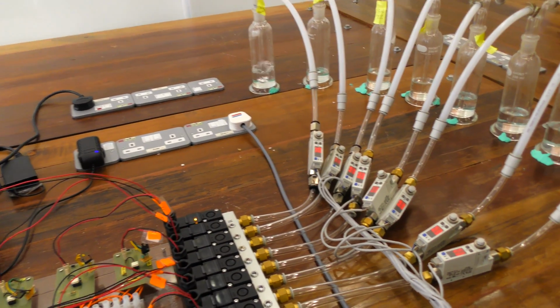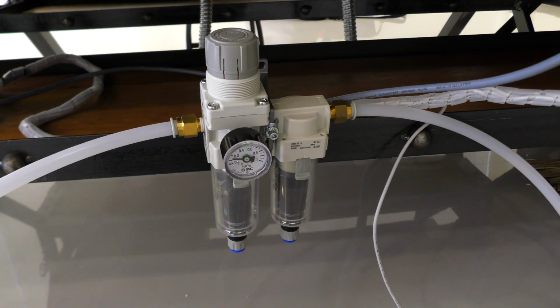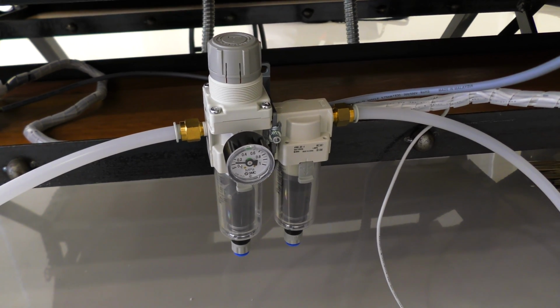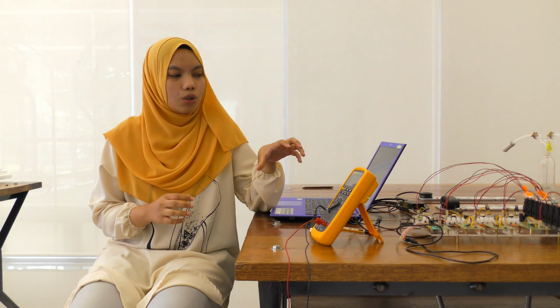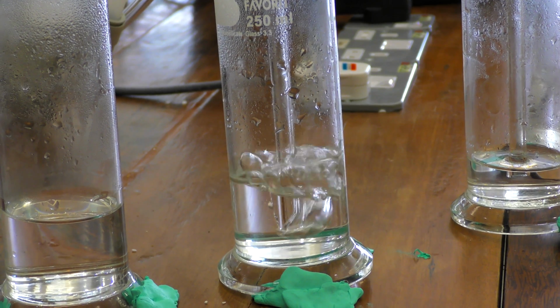For the start of this project, we will use an oil-less piston air compressor to supply air to the solenoid. The solenoid will be activated once it receives a signal from the Arduino program. Lastly, the user will experience the smell from our olfactometer. So you can smell it and tell me what you have smelled.